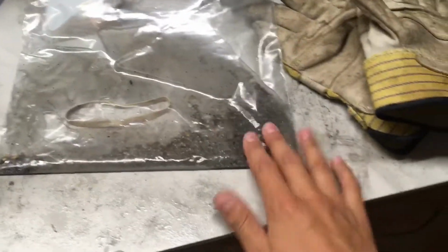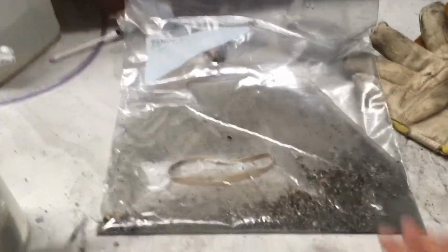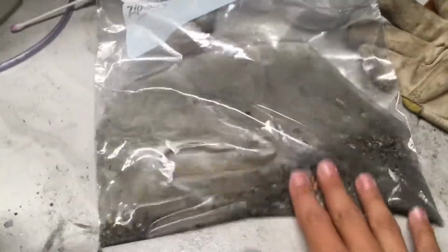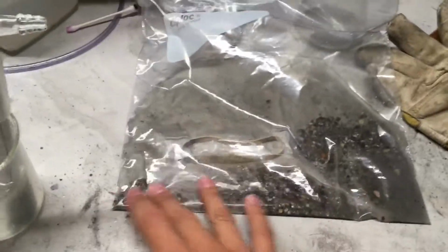This gray residue at the bottom is carbon ash because eggshells are not 100% calcium carbonate. As you can see, there's much less white stuff. I'm going to let this sit overnight and come back to it tomorrow. I hope most of it has dissolved.